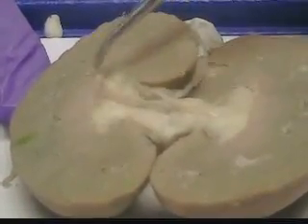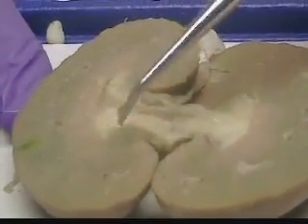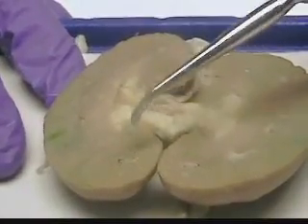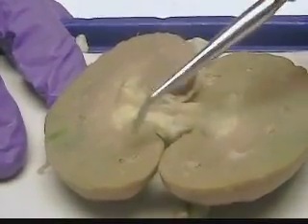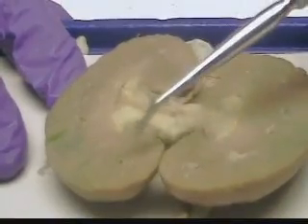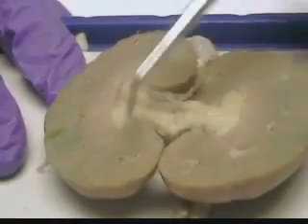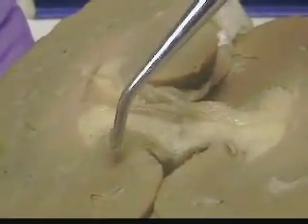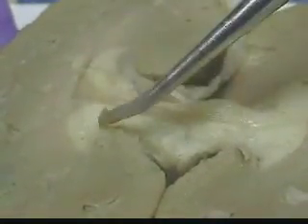Also, in between each renal pyramid, you have what you call renal columns, and they're actually extensions of the cortex. The renal pyramids are also striated, and those striations are due to the collecting ducts of the nephrons, and as they get close to the apex, they fuse and form papillary ducts. And beyond the ducts, which is very hard to see here, you have what you call minor calyces, and those are just extensions of the major calyces.